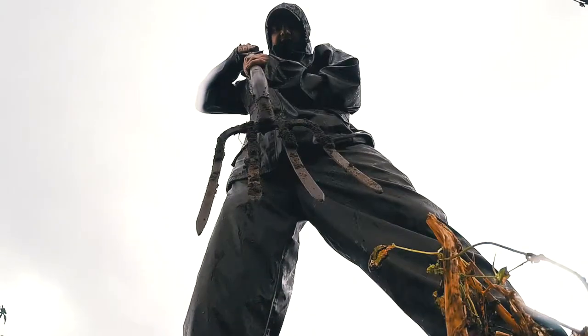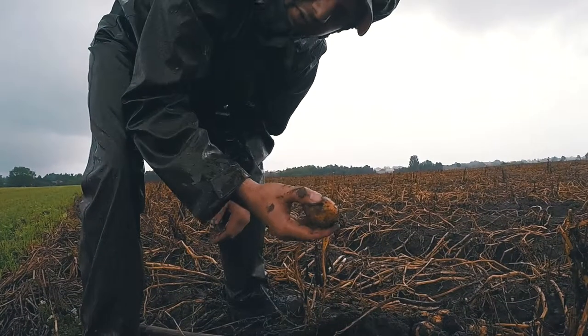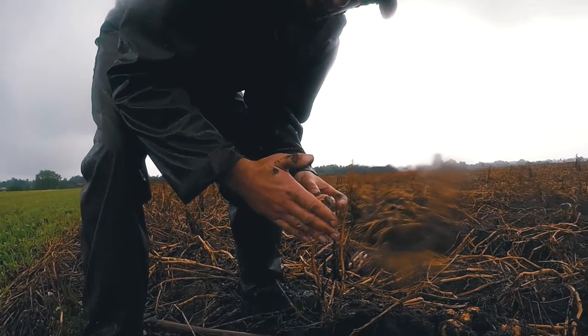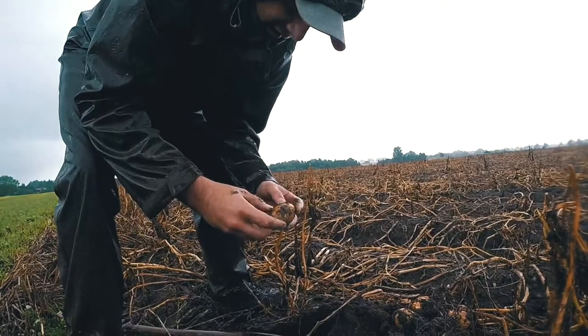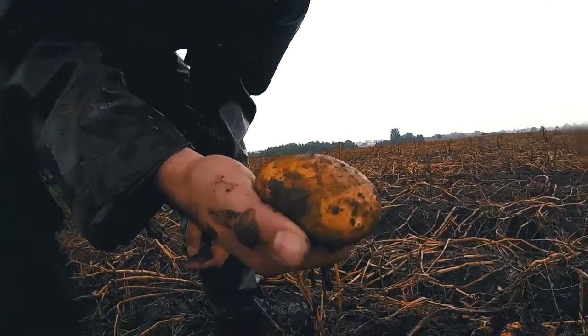So that's what I'm going to show you. And there we've got the potatoes — straight from the dirt of Denmark. We're going to bring these home, slice them up, dry them, burn them, and extract the actual potassium salts from it. And then we'll go from there.